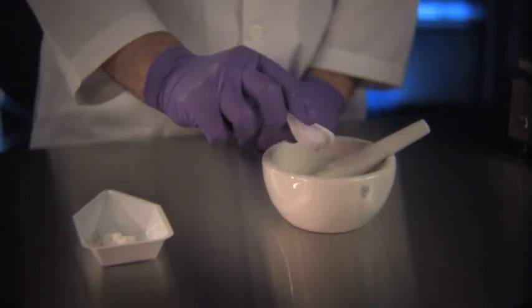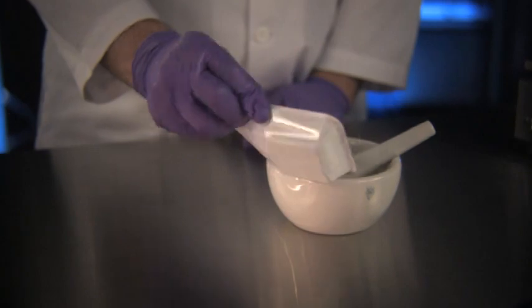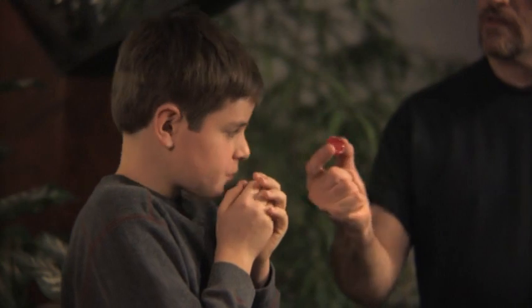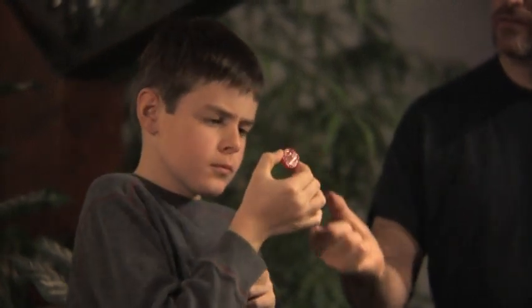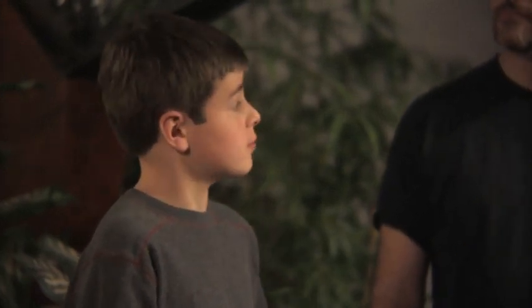First, place the smaller amount of ingredient into the mortar, adding the next larger amount while gradually mixing the two ingredients together. The last of the forms we'll discuss today are lozenges, also called troches. Compounded lozenges are often used by patients who cannot swallow a commercially available product, or for patients who need a topical application to the mouth or throat to relieve soreness or an infection.